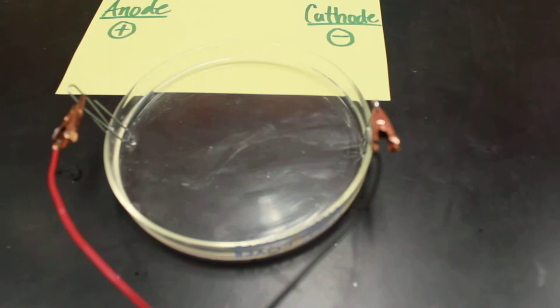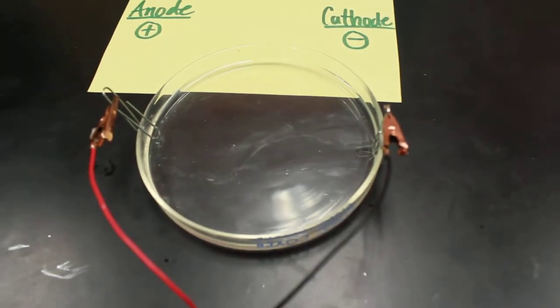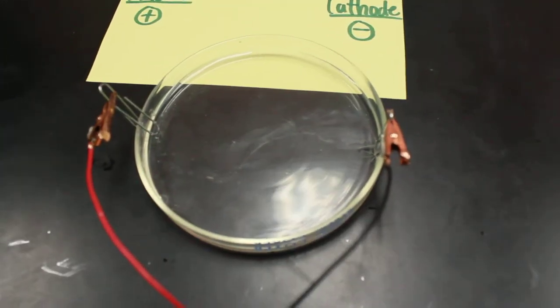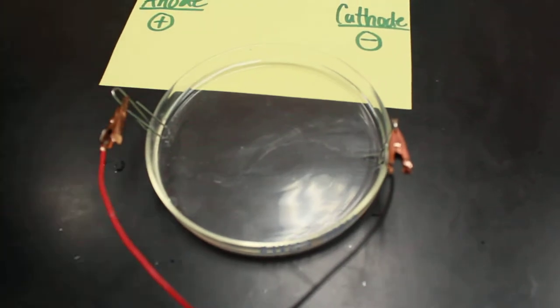And this is building precipitates, or your tree, from the chloride that it's in, the tin chloride.